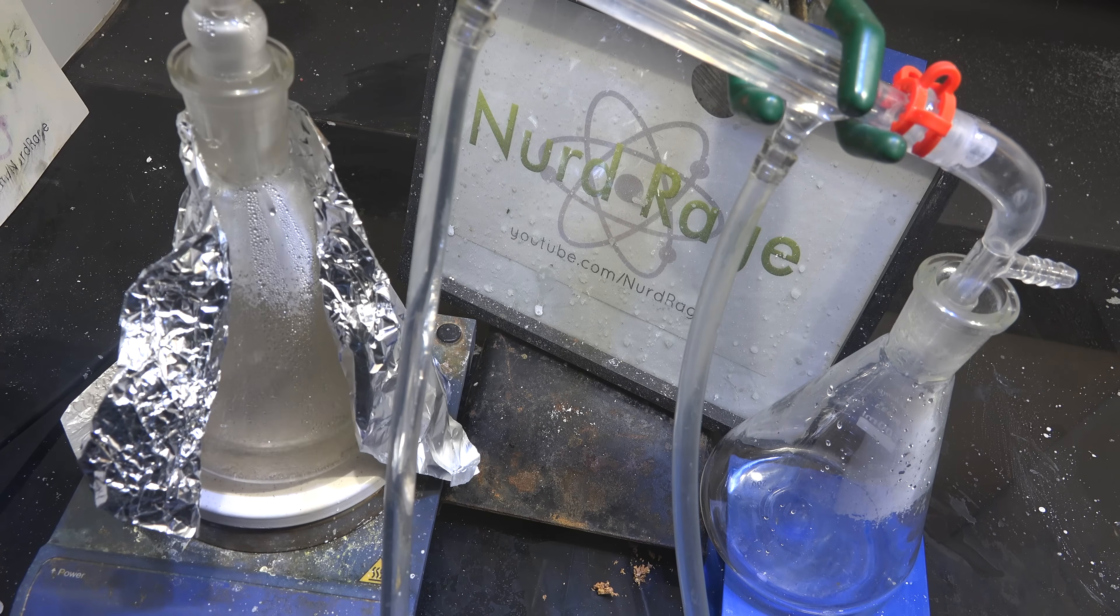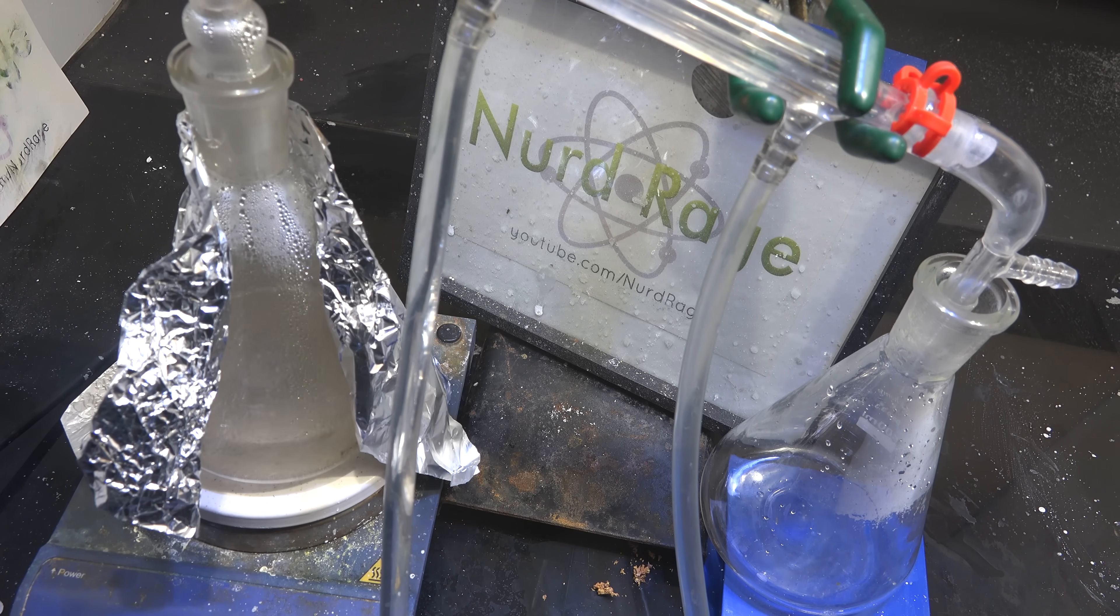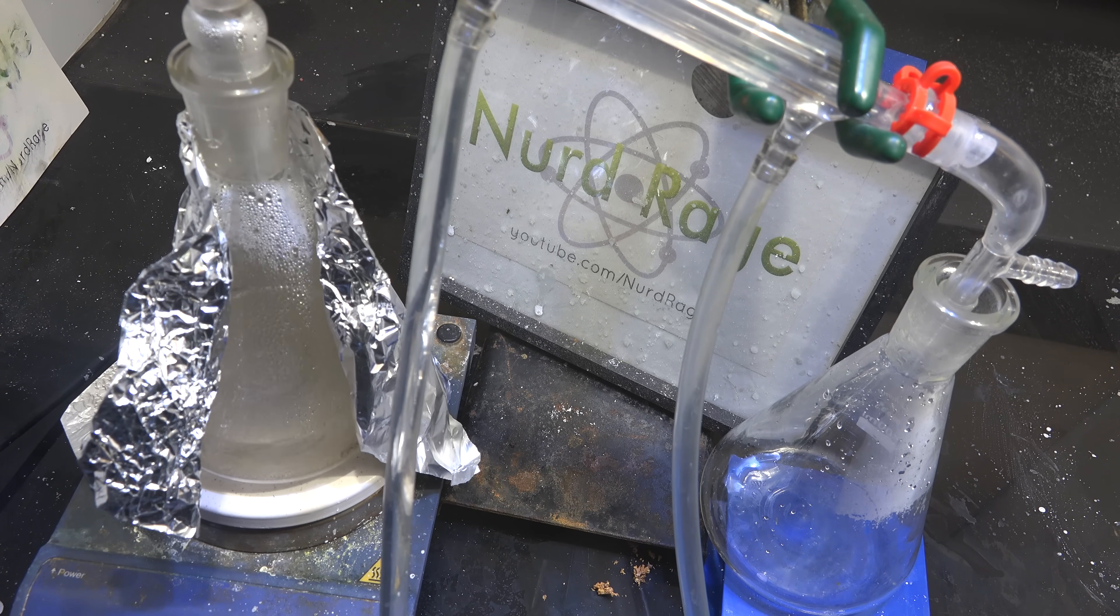Okay so what's happening chemically? First the excess water from both the glycerol and the oxalic acid distills over.